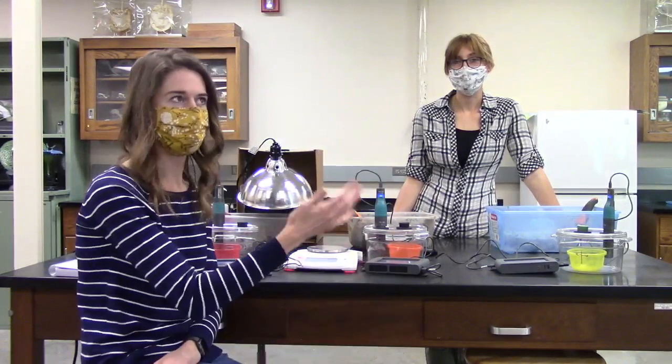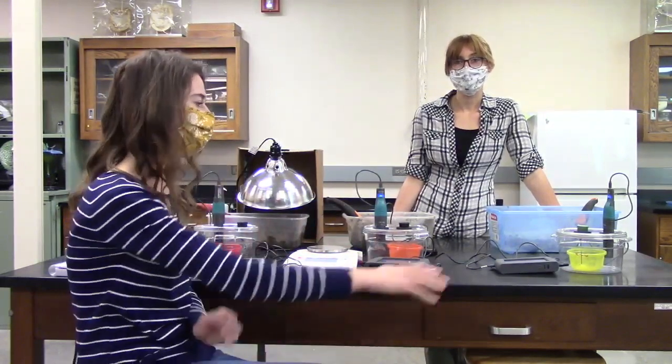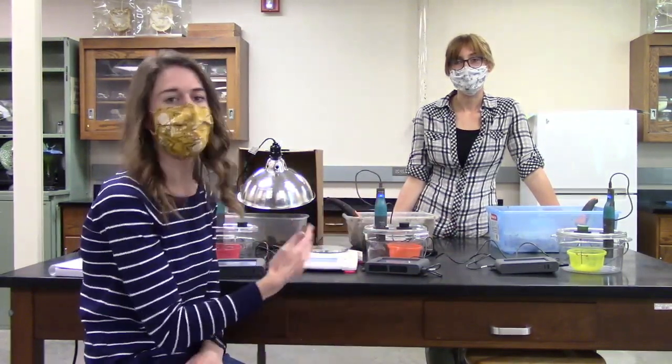They consume food of some sort in the soil, and then they're going to produce CO2, whereas plants that you're used to seeing, like trees, are going to use CO2 and produce oxygen. It's kind of weird to think that there are these microscopic organisms using the same metabolic processes that we are, and they're putting off CO2. So when we keep them in these enclosed chambers, we're able to measure that change in CO2 to see how much microorganism activity there is in our soil.